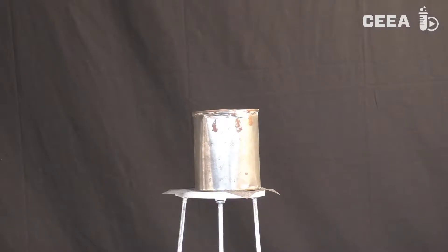After the filling, the can is placed on a tripod. The hole in the bottom has to remain unobstructed.